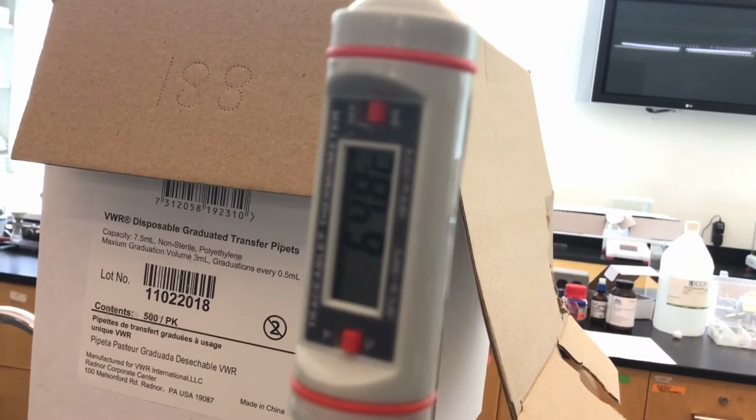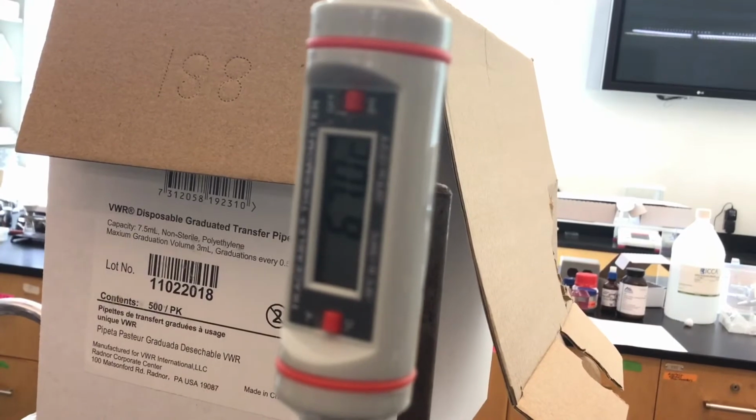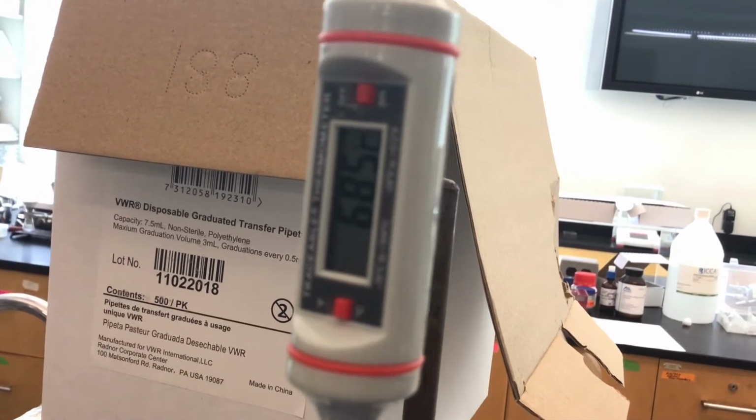Oh, it's going up. All right, never mind.